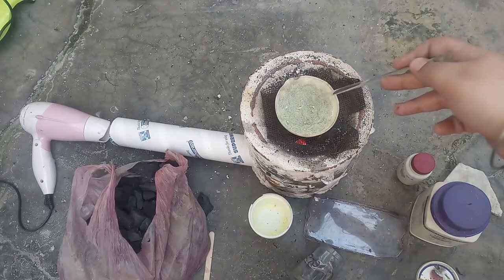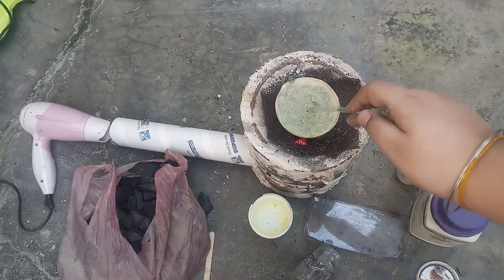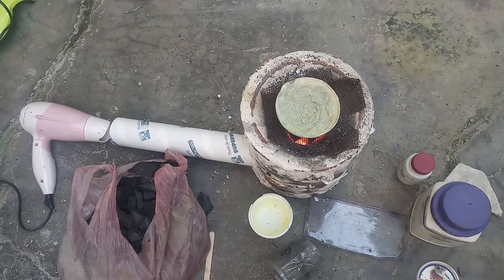The sulfur will burn into sulfur dioxide and trioxide gases, so be careful. The dust must also be avoided because they are always harmful. You must watch the reaction.